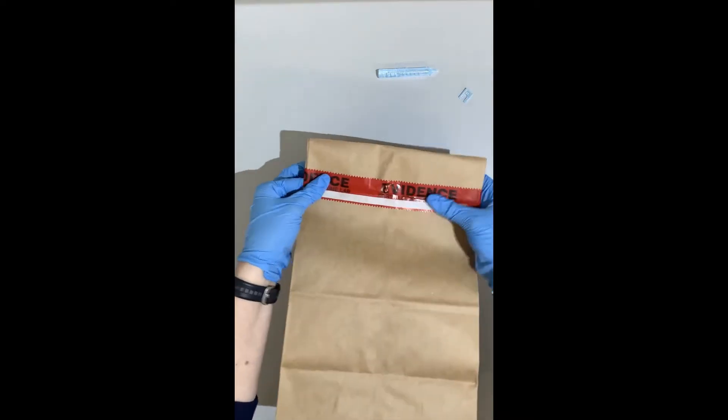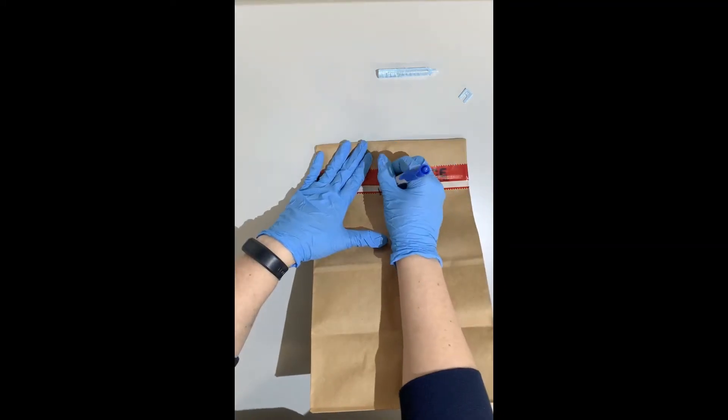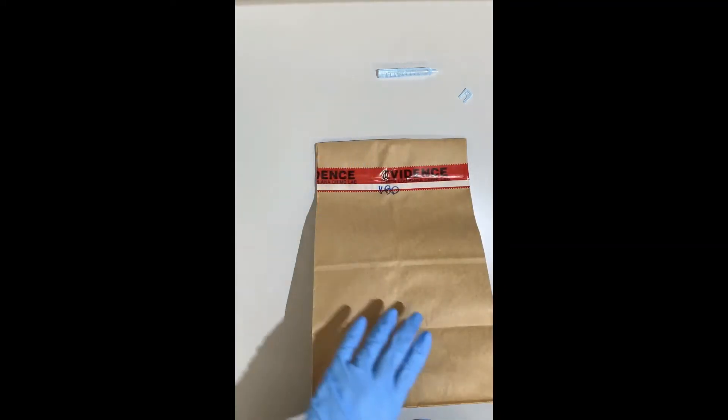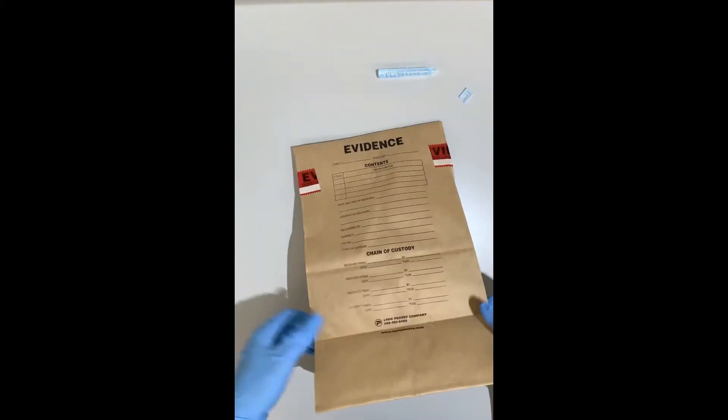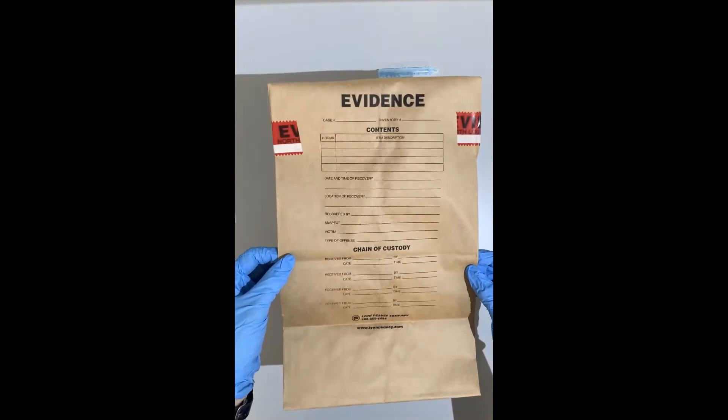Try not to get it stuck on everything and then initial on the seal. Now this empty water bottle is good to go and be brought to the lab for DNA analysis.